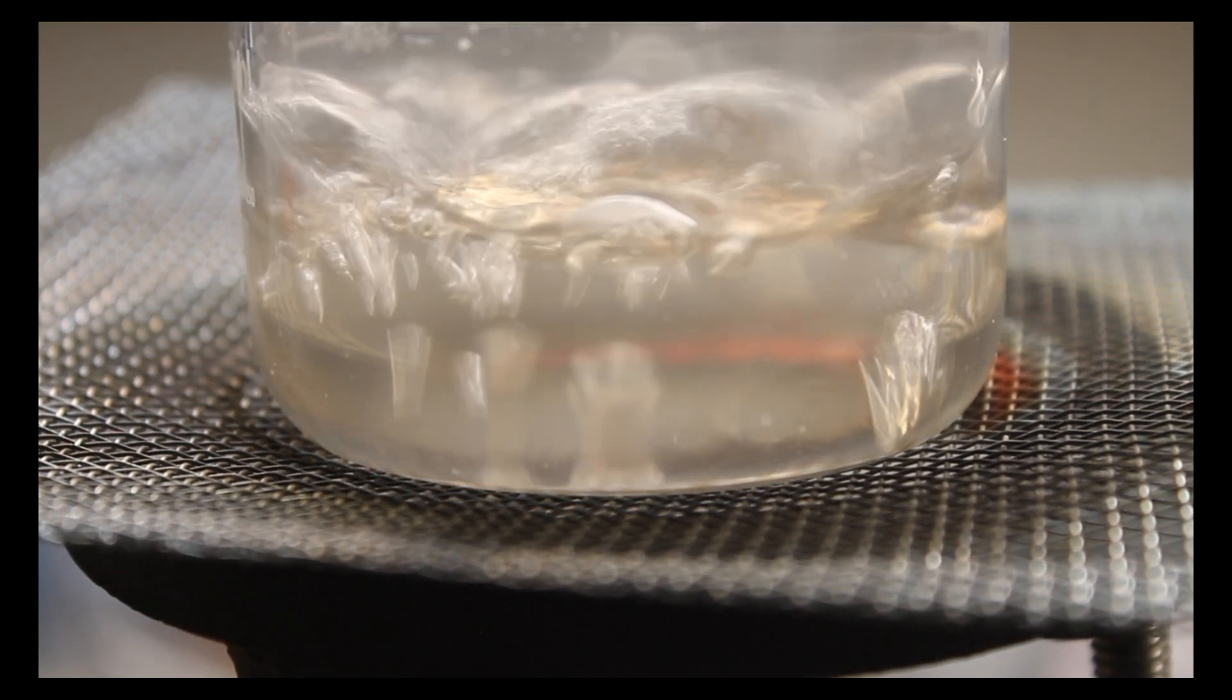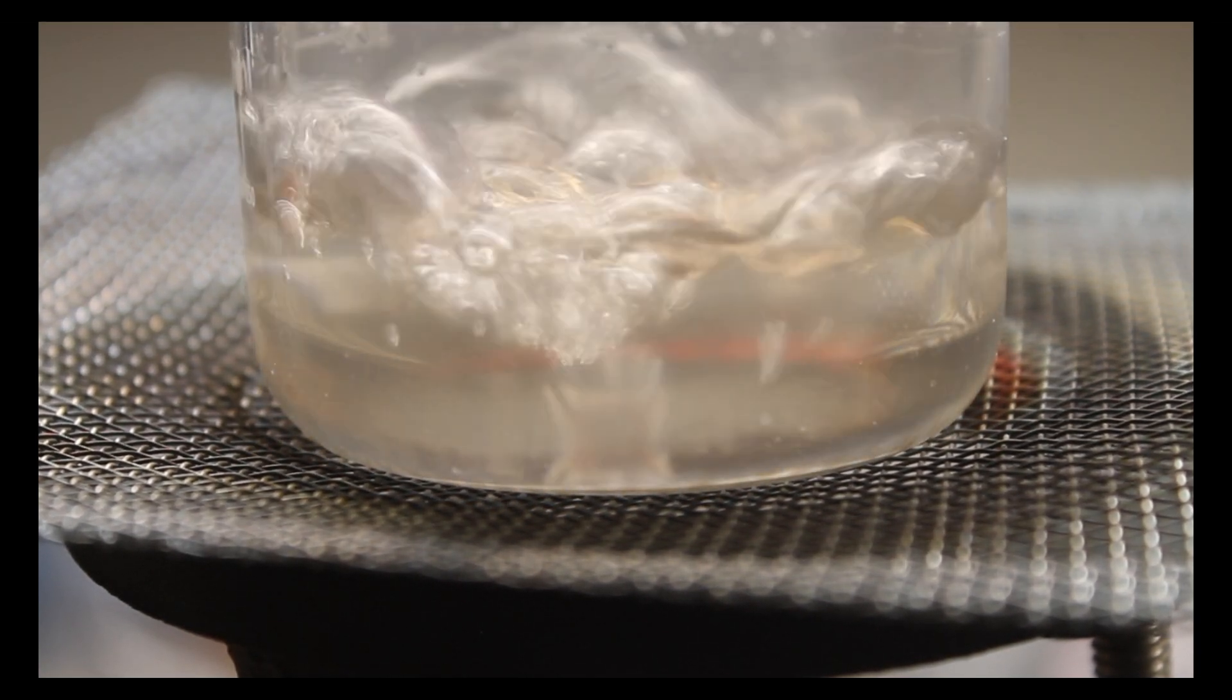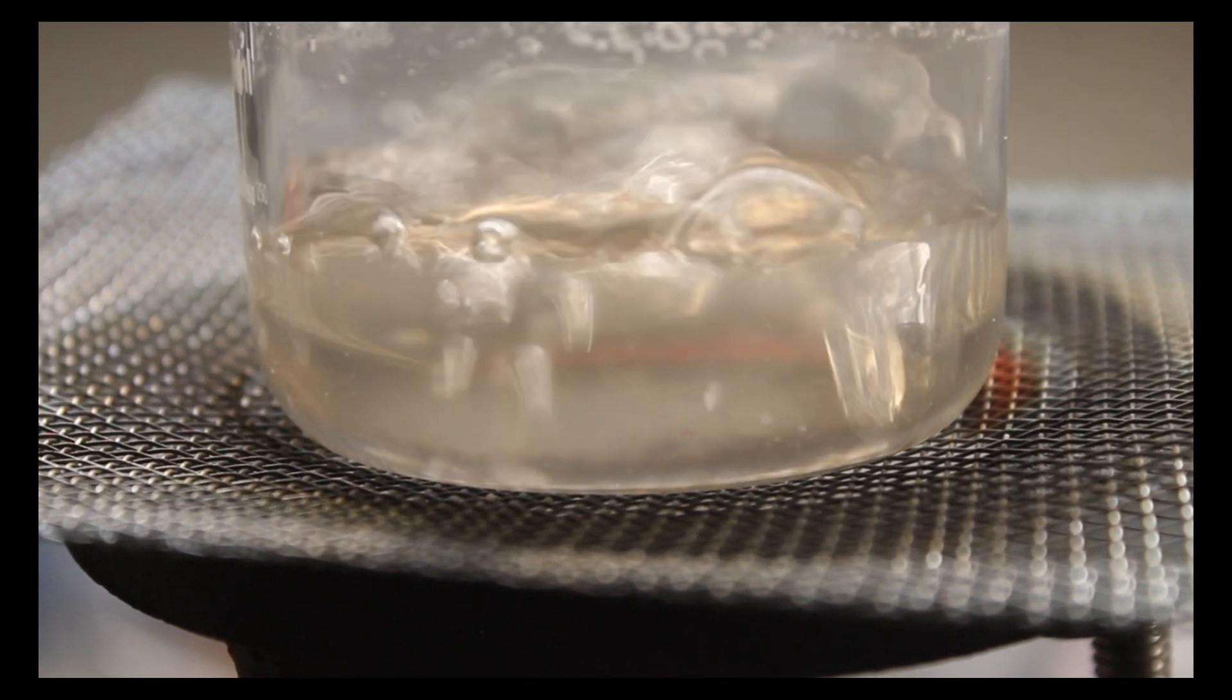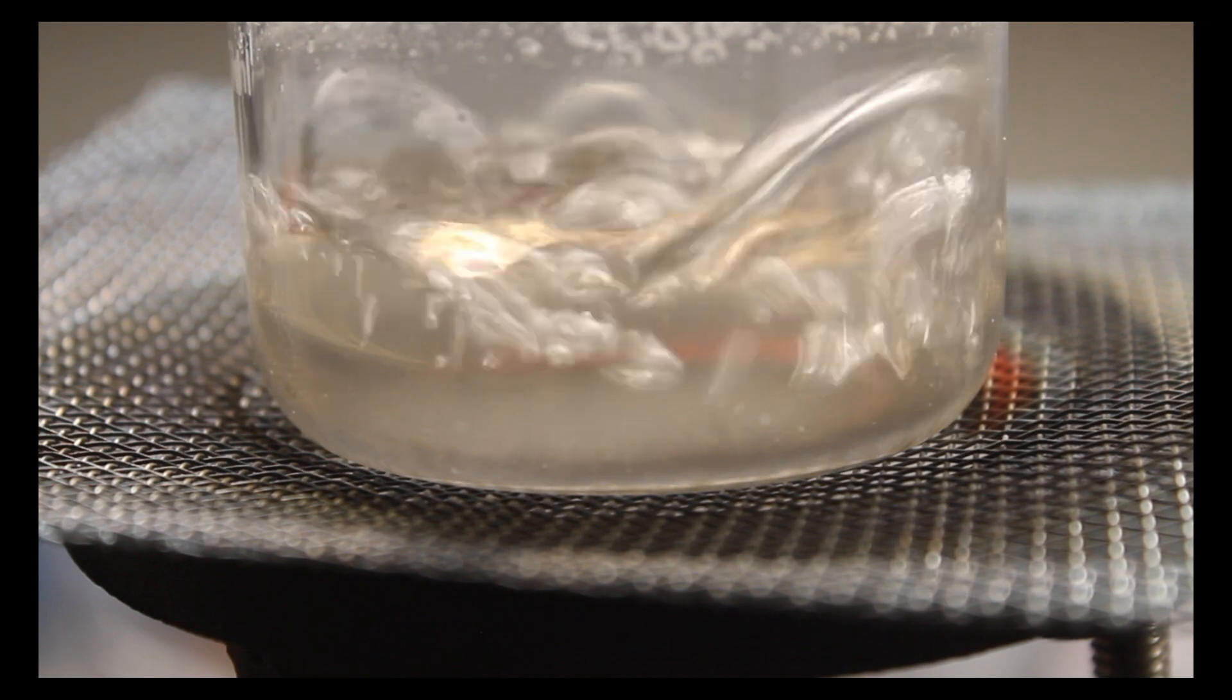As the water level drops, we begin to see depositions of crystal sodium chloride on the edge of the beaker.